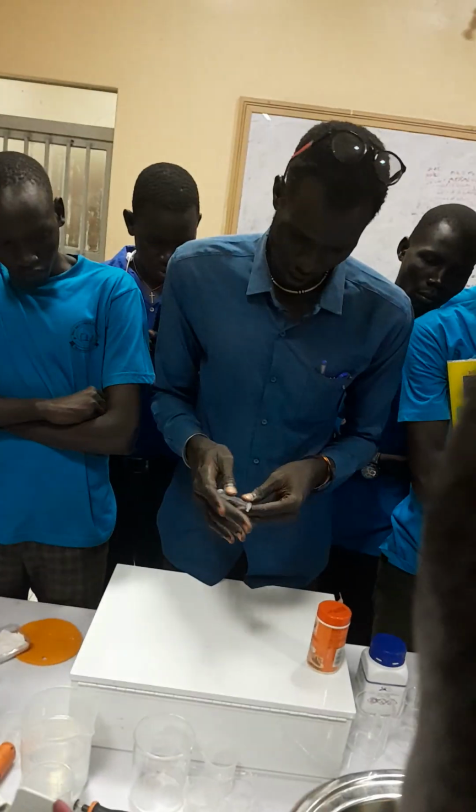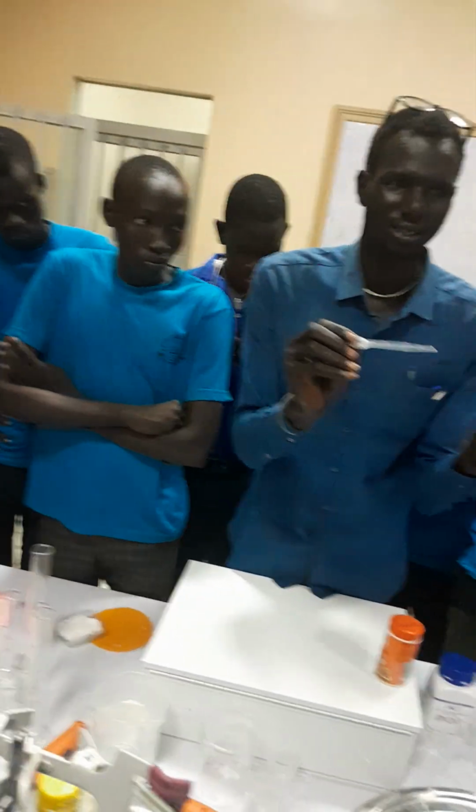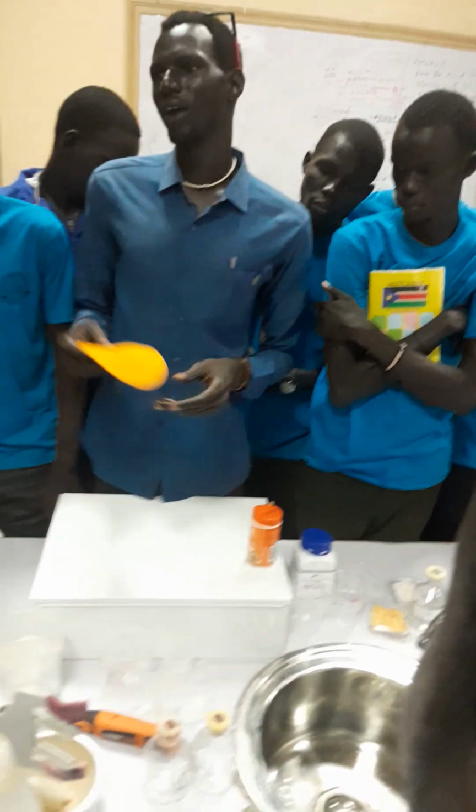Okay. Now, what is the name for this? This one is the dropper. Dropper, yes. Or dropping any liquid, or reduce. Then now, dropper. Now we have this.